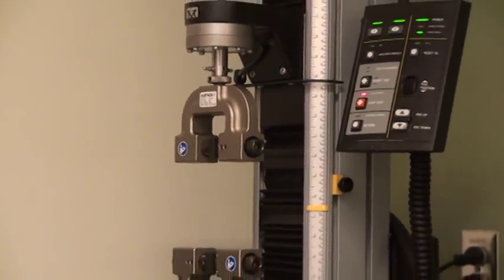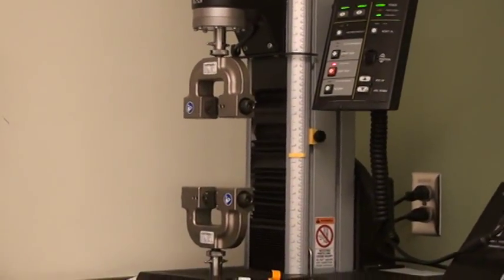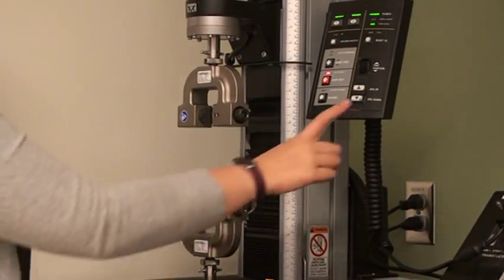Before testing, make sure you set your safety stops. The stops should be set so that they prevent the grips from making contact with one another.